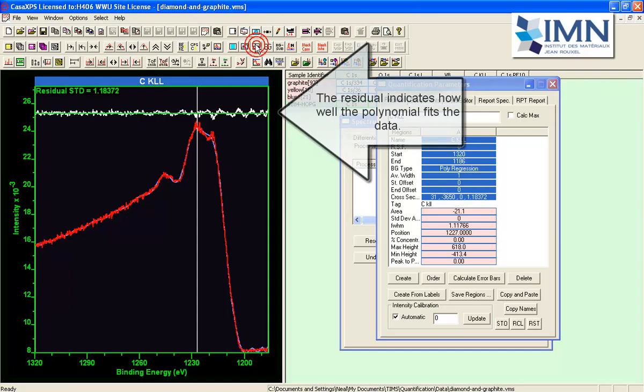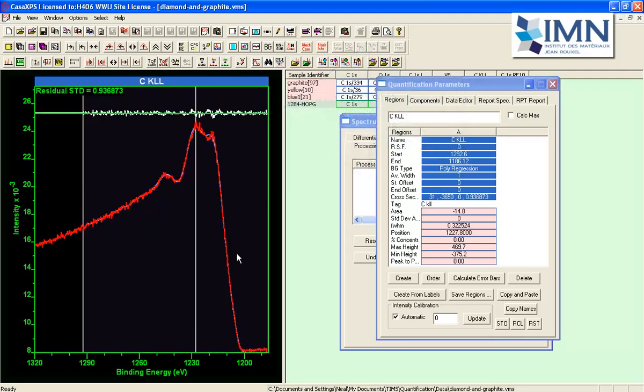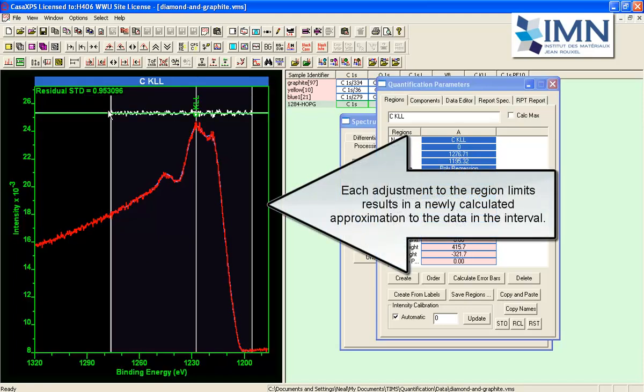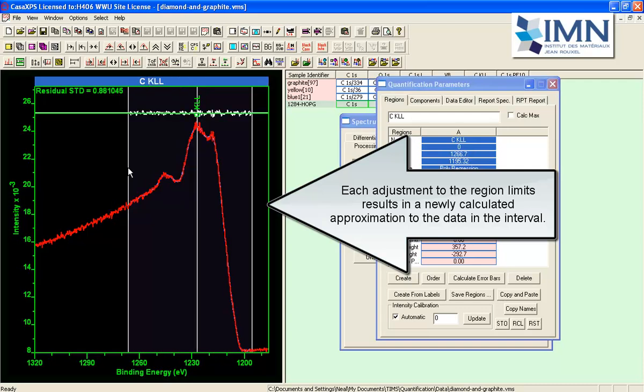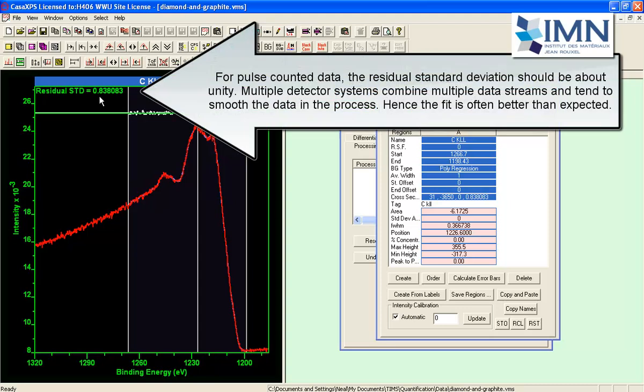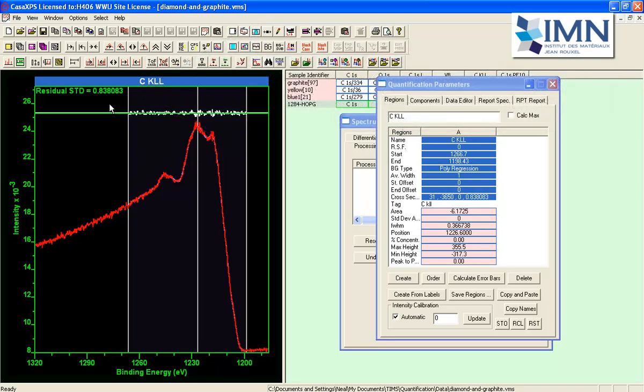And you can see how well this polynomial is fitting the data by looking at the residual. And if I restrict the range over which the polynomial needs to fit the data, I can see how the residual improves as I shrink the interval. And if I just get this right, then I come up with a residual standard deviation that would be characteristic of pulse counted data which has been combined from a multiple detector system, so it's less than 1.